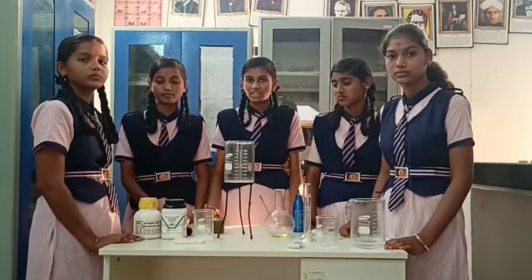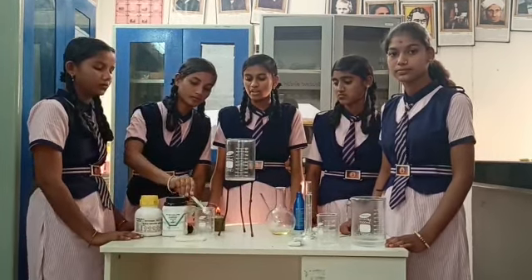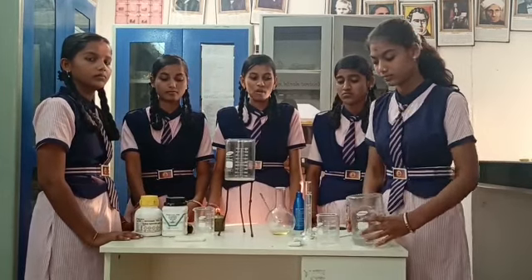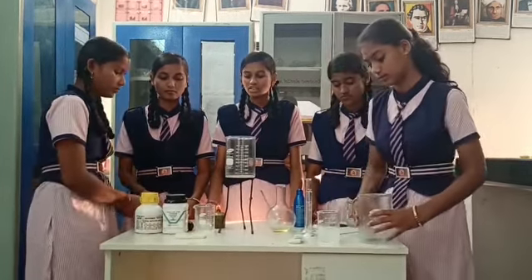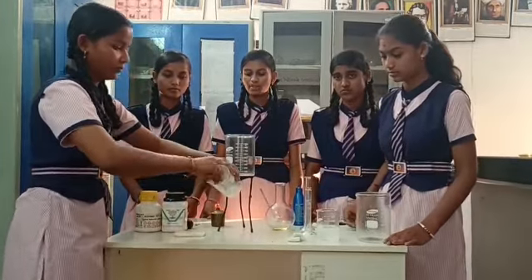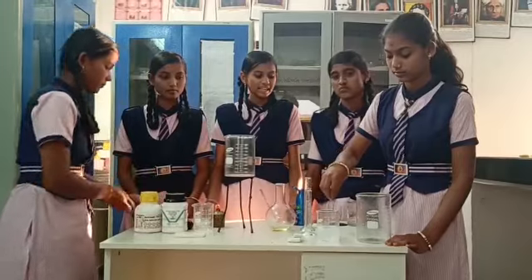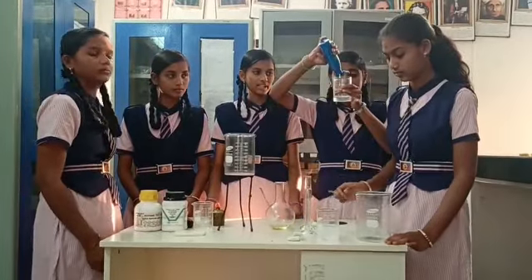Take 0.5 gram of Potassium Hydroxide and Sodium Hydroxide in a Beaker. Take 100 ml of Water in another Beaker. Add 0.5 gram of Potassium Hydroxide and Sodium Hydroxide in another Beaker. Stir well. Take 90 ml of Coconut Oil in another Beaker.